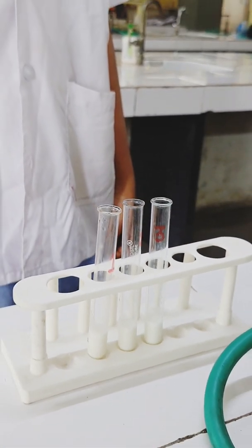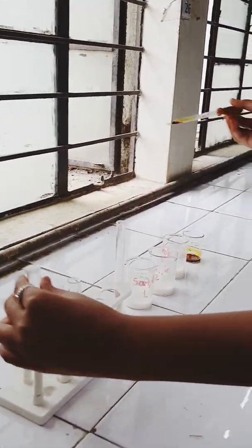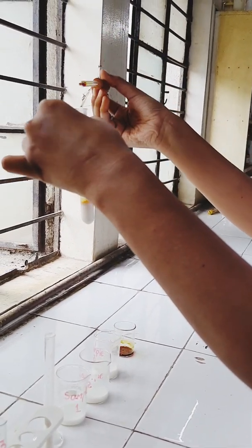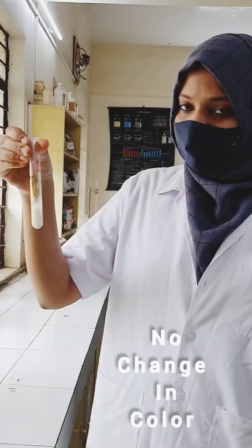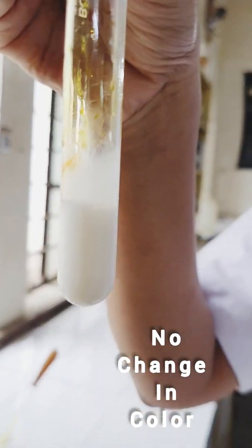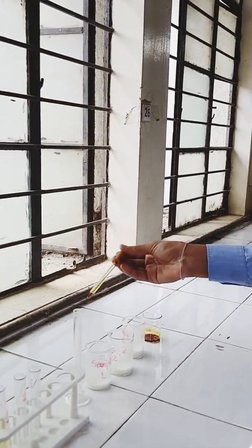Now, add 2 to 3 drops of iodine solution and mix well. Here, we are adding iodine drops to the first sample of milk. Mix it well. We can observe there is no change in color, which means the milk is not adulterated with starch.